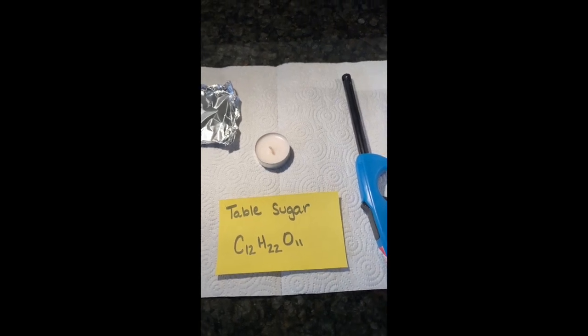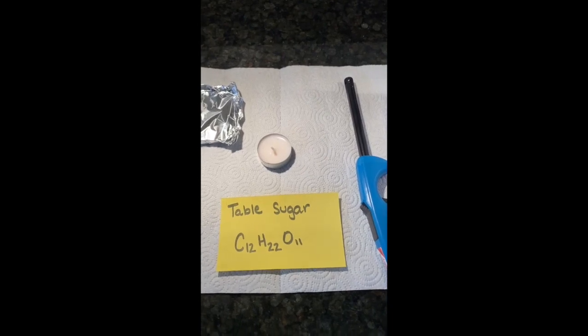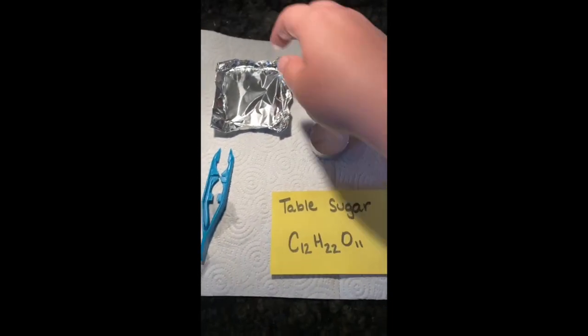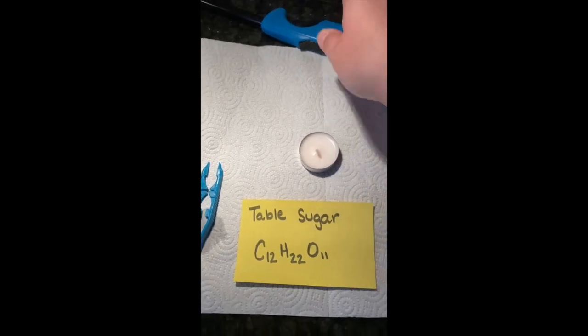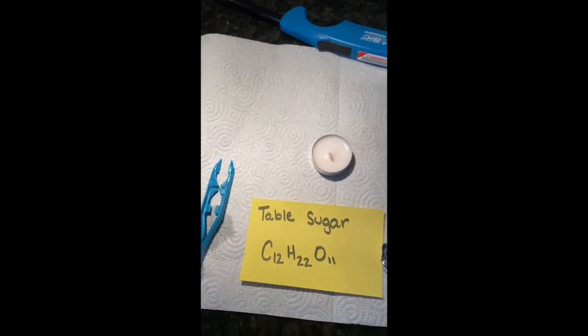So if you have a solid ice cube and you melt it to water, it's water before, it's water after. That is not a chemical change. We need a new substance. So we'll get started on our second one here. Using good lab safety, I'm not on camera today, but my hair is tied back. You don't want your hair down if you're working with fire here and things like that.